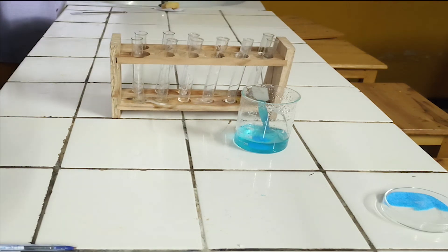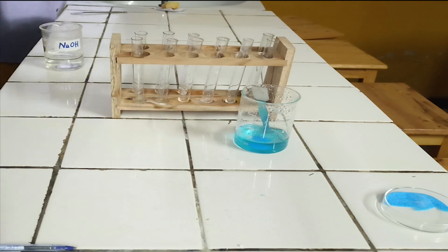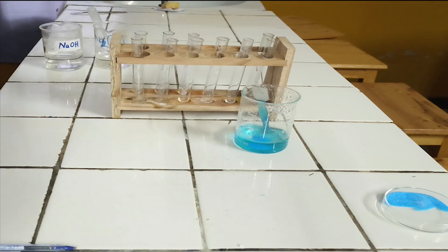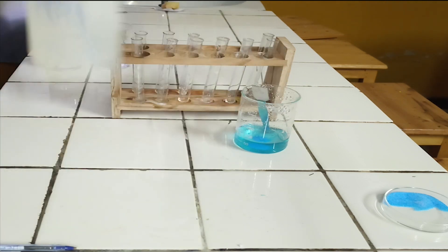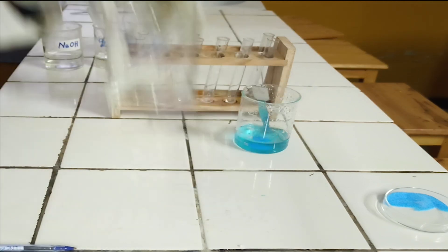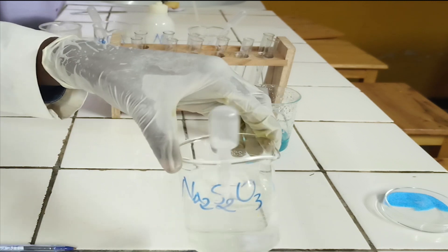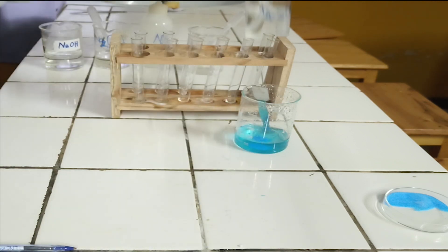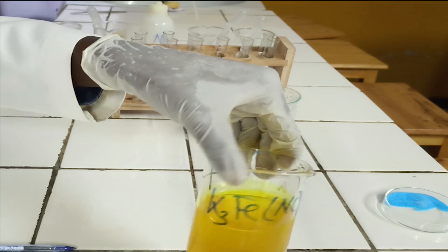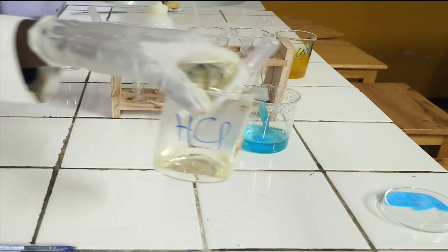Chemicals required: 1. Sodium hydroxide solution. 2. Sodium carbonate solution. 3. Diluted ammonia. 4. Potassium iodide. 5. Sodium thiosulfate. 6. Potassium hexacyanoferrate. 7. Concentrated hydrochloric acid.